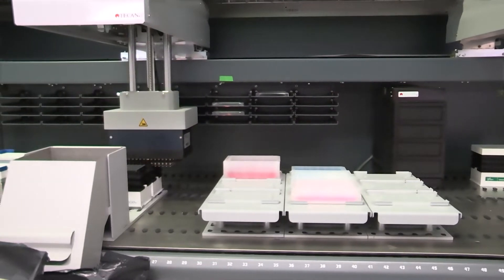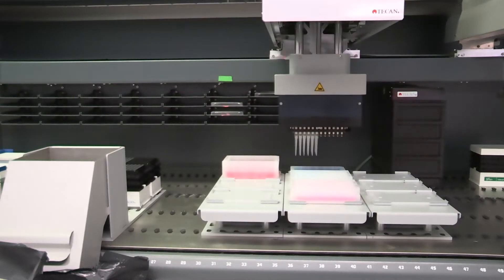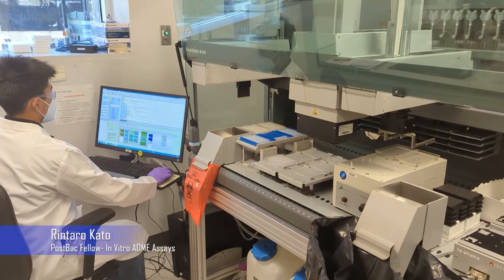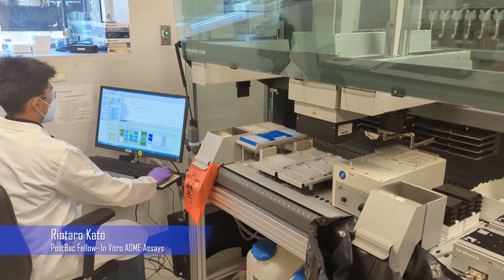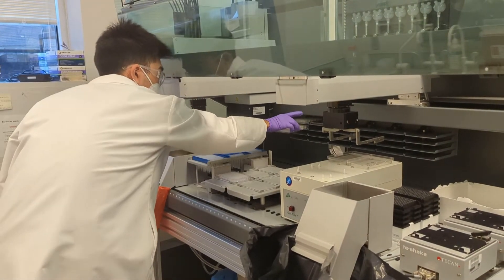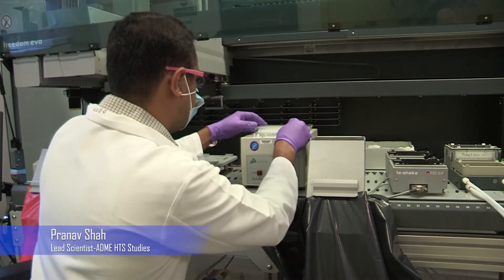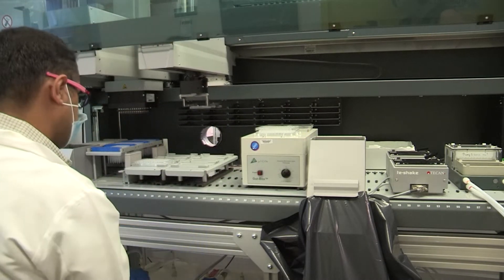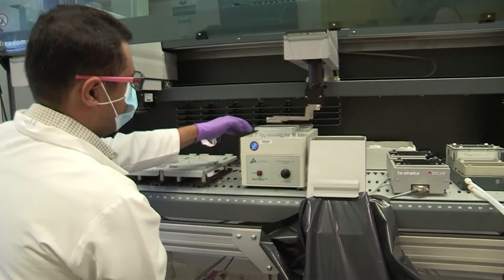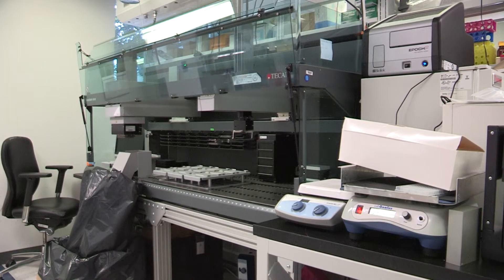Chemists are synthesizing new compounds for these projects every week. These compounds are first purified and registered with NCATS Compound Management. Once registered, these compounds make it to the in vitro ADME group for testing in three important ADME assays, including kinetic aqueous solubility, Pampa permeability, and rat liver microsomal stability. These constitute the Tier 1 suite of ADME assays.